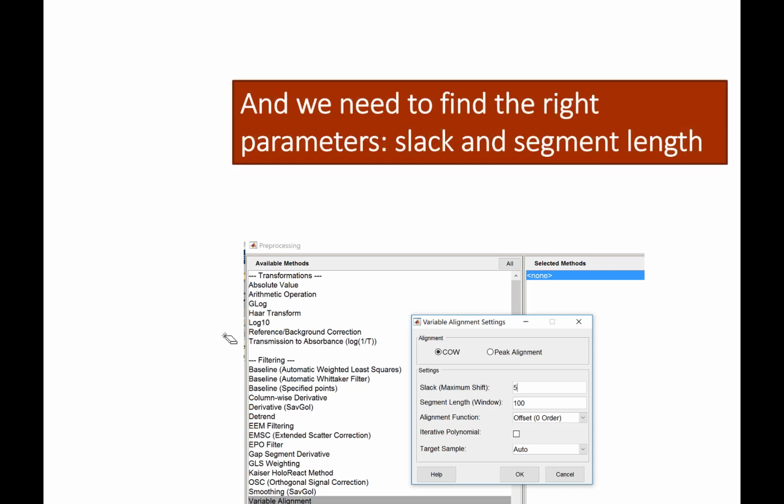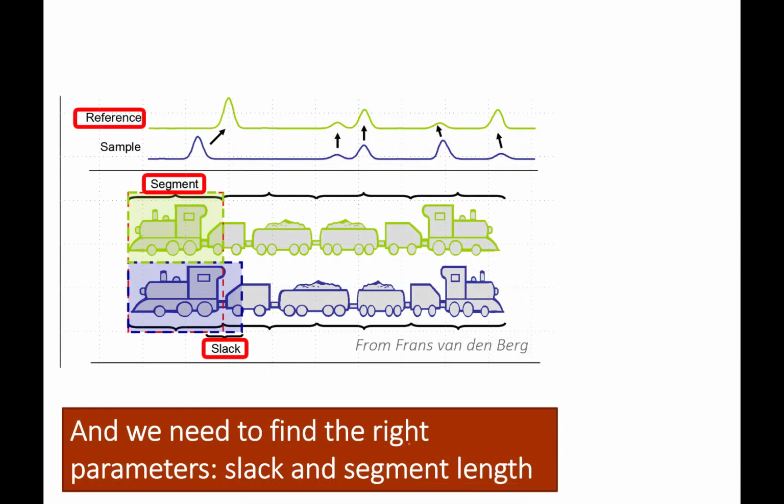Okay. So there are two parameters that we need to, well, maybe actually three. There's the slack, the segment, and the target sample. The segment is simply the length of each interval. The wider you make that segment, so let's say I only do 2 segments, then you have very little flexibility, and there's very little you can change.